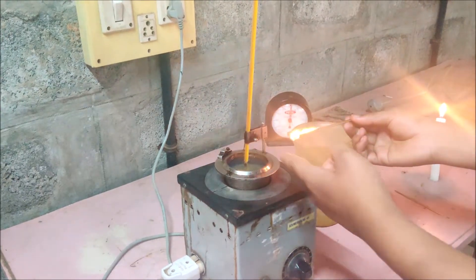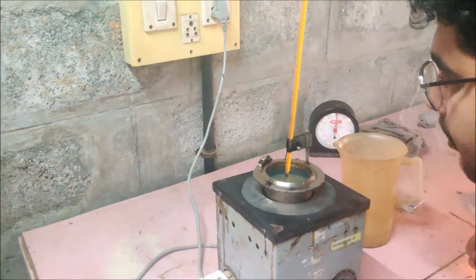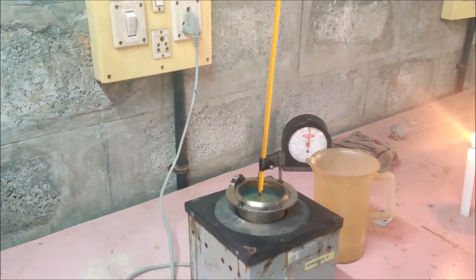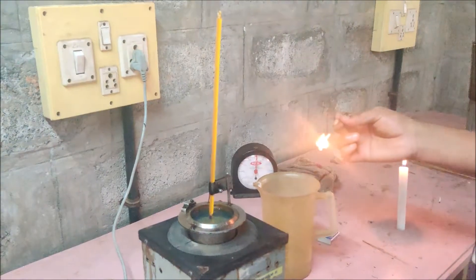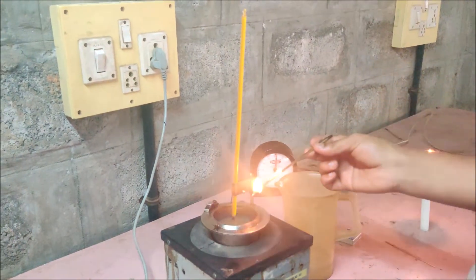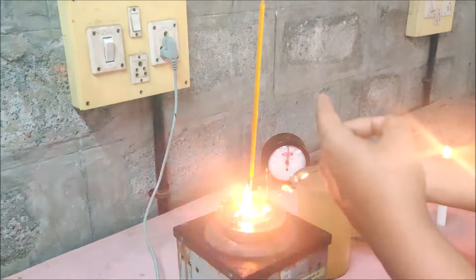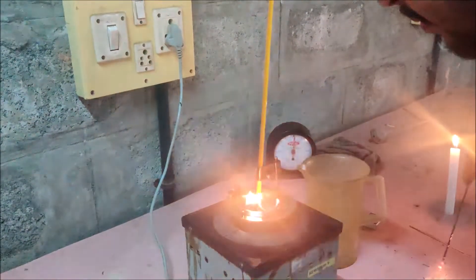There was a flash. Once you get the flash, you have to note the temperature. I got it at 50 degrees. Now once it completely catches on fire, you have to note down that temperature as well. It's at 56 degrees.